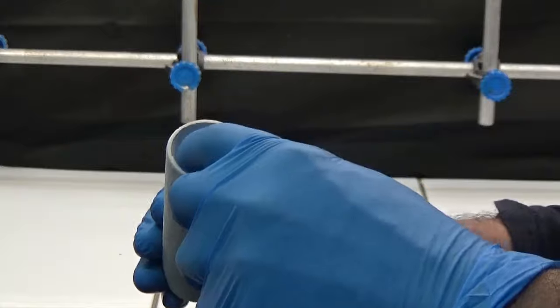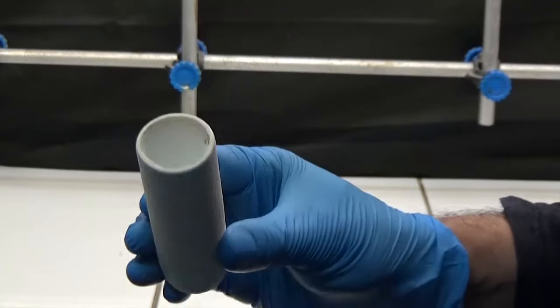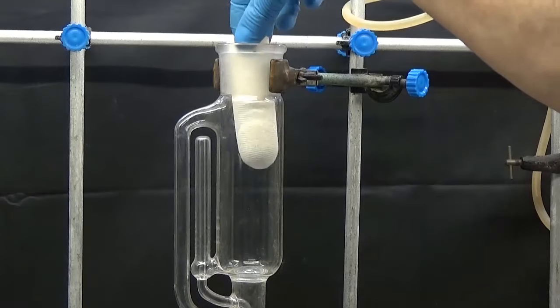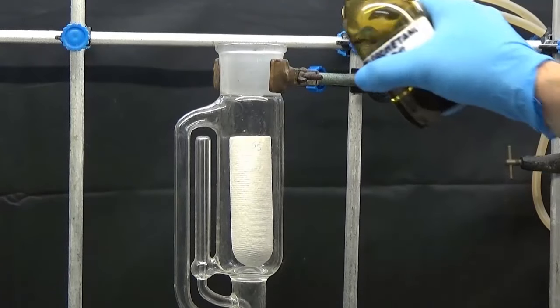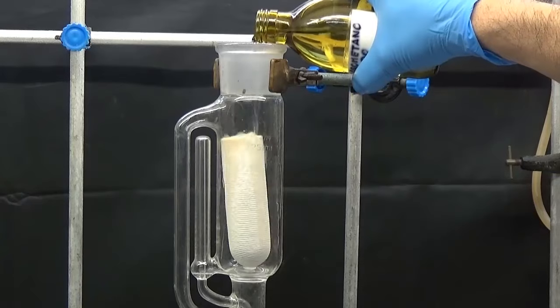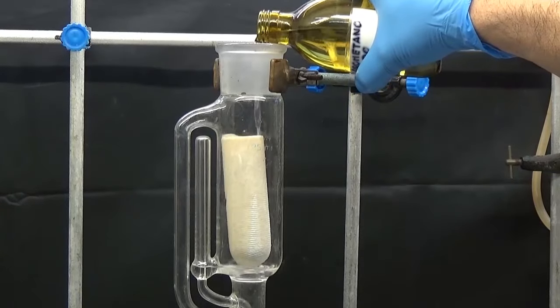We added 250 to 300 milliliters of dichloromethane.